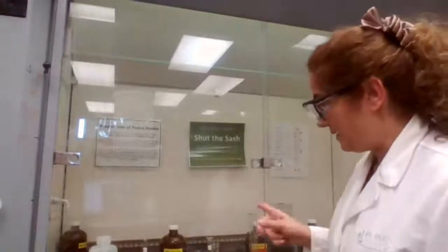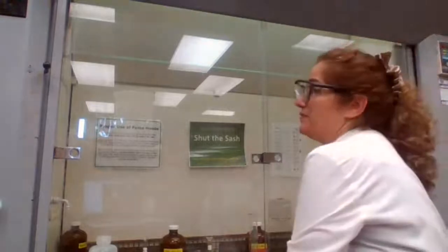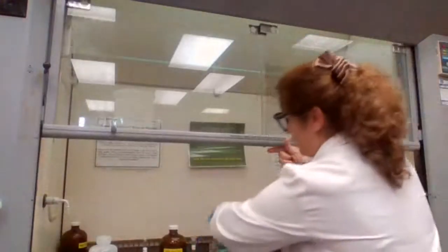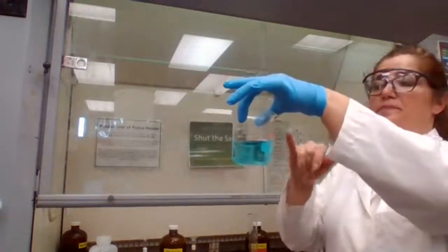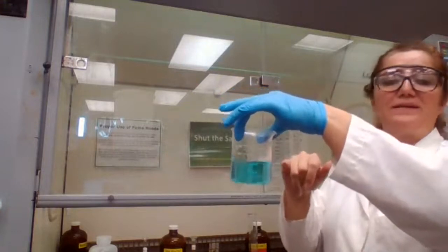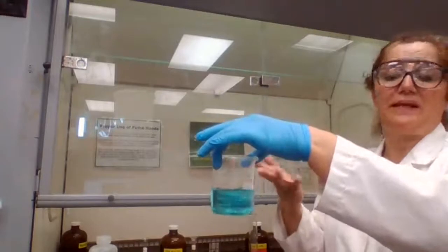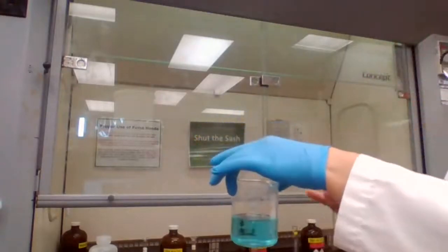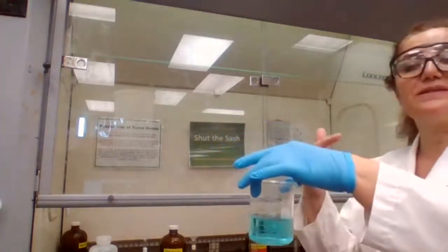The brown gas, which was toxic, is now gone, and it's safe for me to work with this solution. What I want you to do, I want you to write your observation after adding nitric acid and water, because I had to add the water first before I can take it out. I add the 100 mils of water before I can take it out. So write your observation and tell me what is the next step.